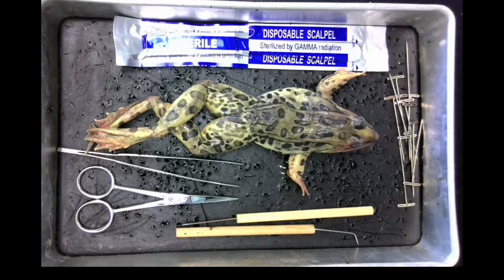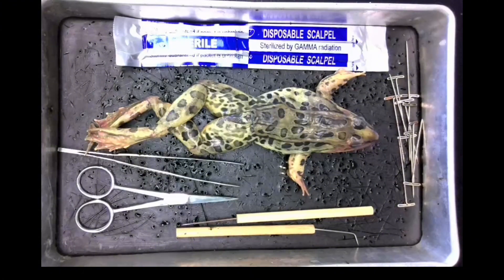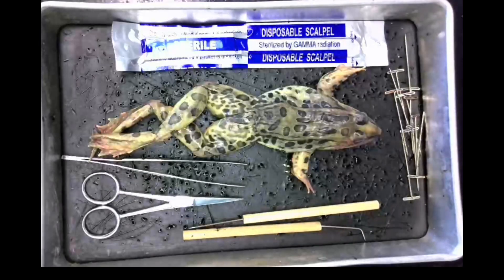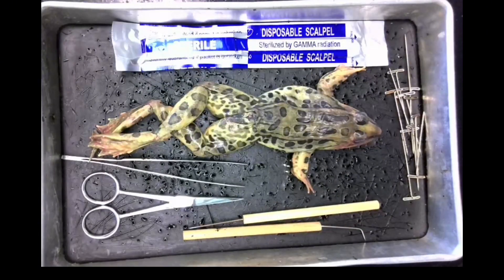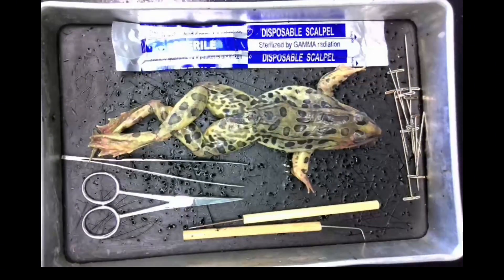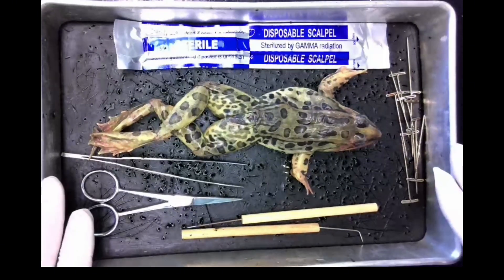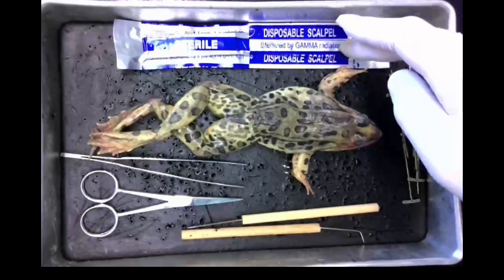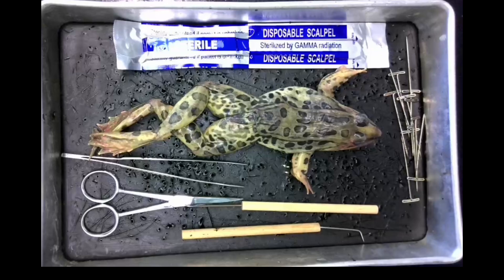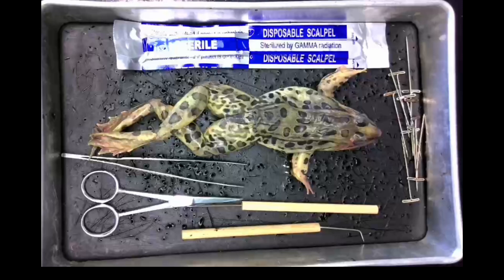In this investigation we'll be examining the external structures and internal structures of a frog. To start, the frog has been rinsed carefully under water to remove as much of the preservative as possible. We're going to be using the following tools in our dissection kit: we have our scissors, dissection tray and pad, scalpel, forceps, pins, and probes. Always good to use gloves as well and safety goggles.